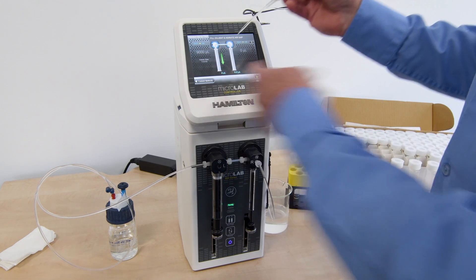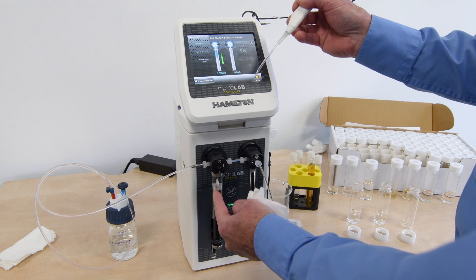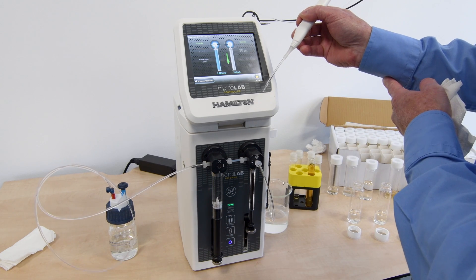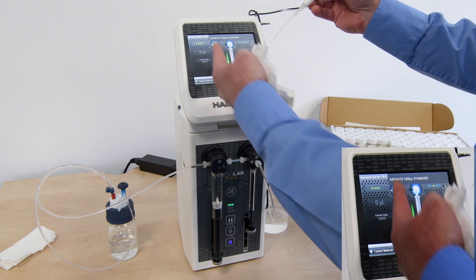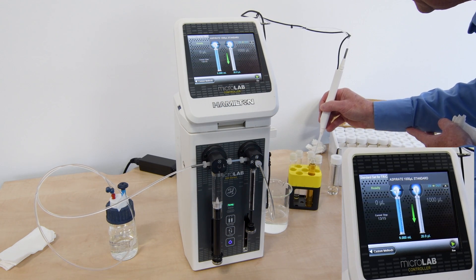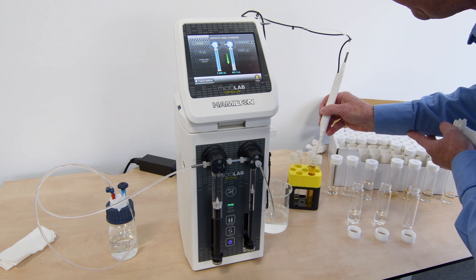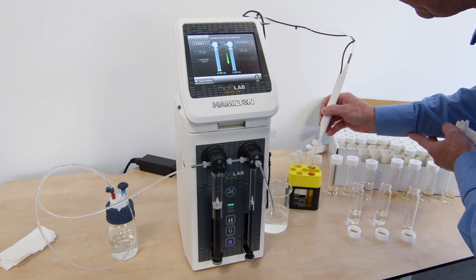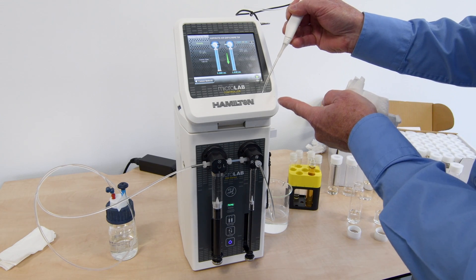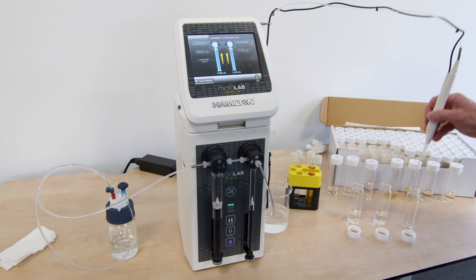The next step is picking up 9,000 microlitres of diluent and then an air gap. Now it's asking me to pick up 1,000 microlitres as a standard. Pick up air gap, wipe the tip, and dispense.